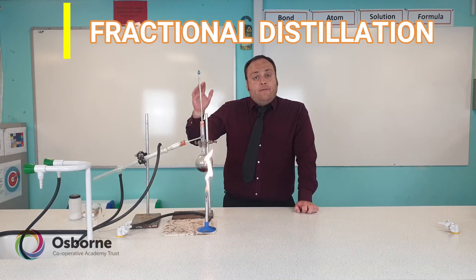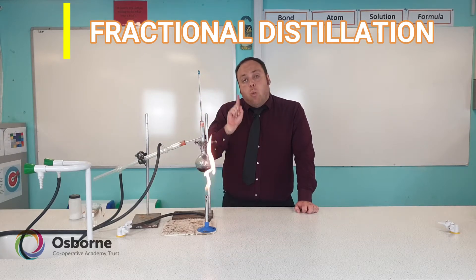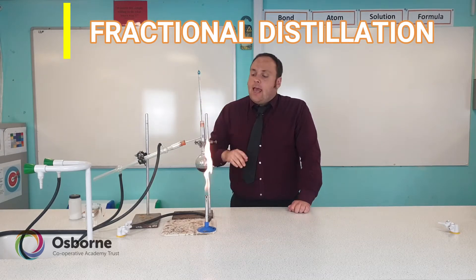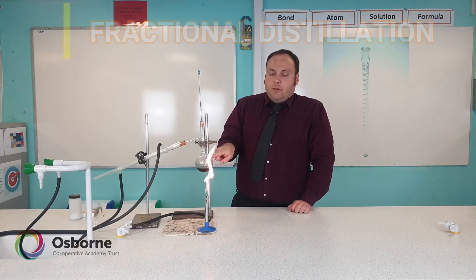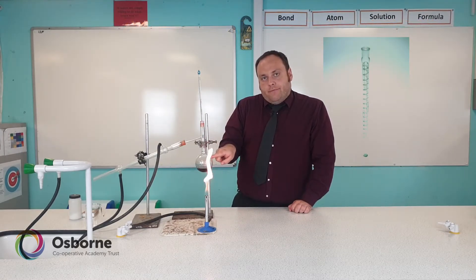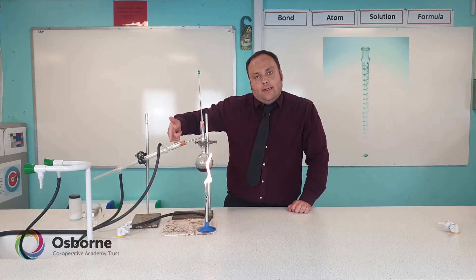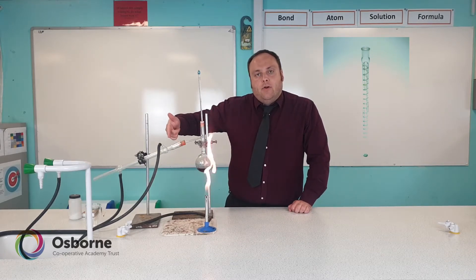The still for fractional distillation has one extra piece of equipment: a fractionating column that goes between the round bottom flask and the condenser, which I'll talk about later on.